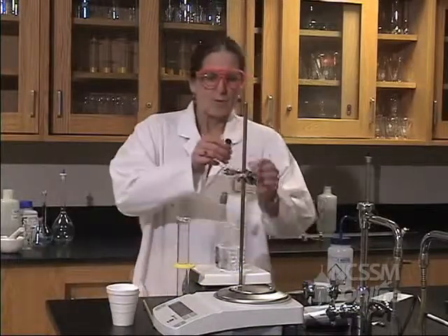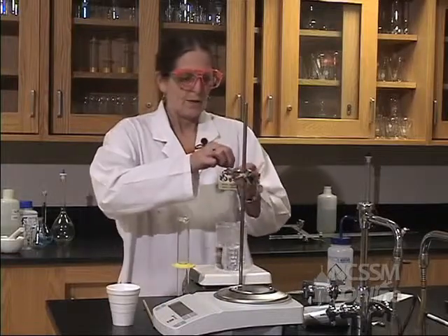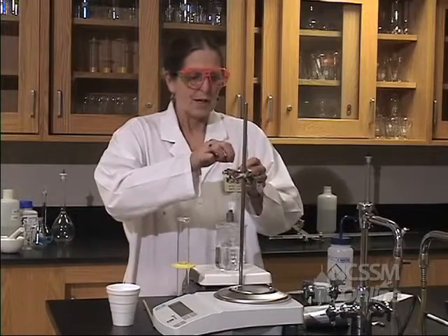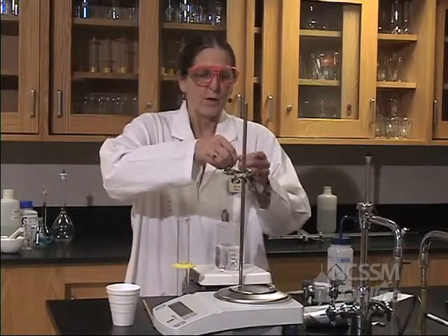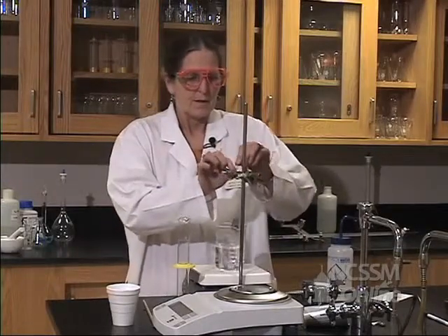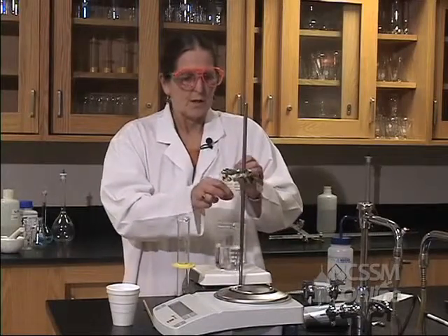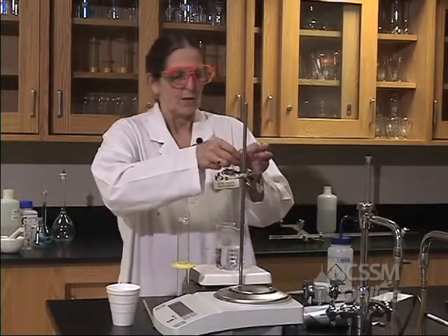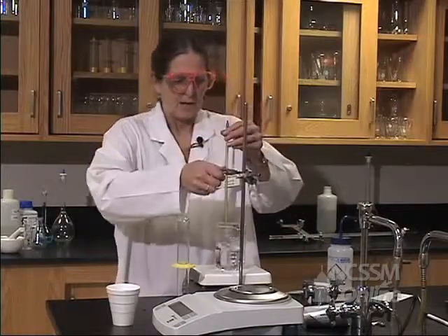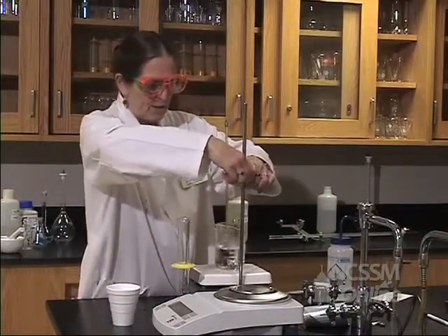And we have our water boiling, so we're going to tie a string to our sample so that it doesn't touch the bottom of the beaker. If it touches the bottom of the beaker, then we don't know for sure what the temperature is. But if it stays in the water, then we know that the metal will be the same temperature as the water temperature. Let's put our thermometer in the water, about the same height, and then we'll lower everything in the water together.